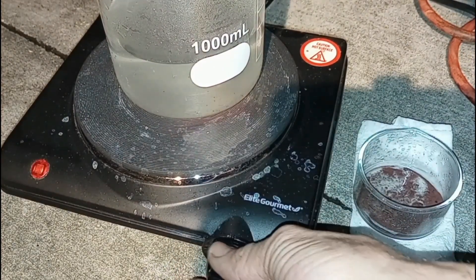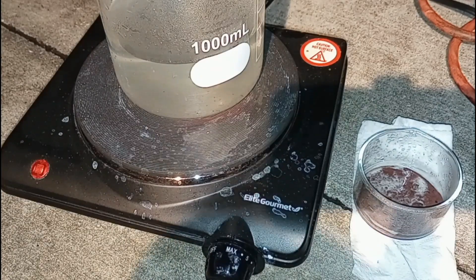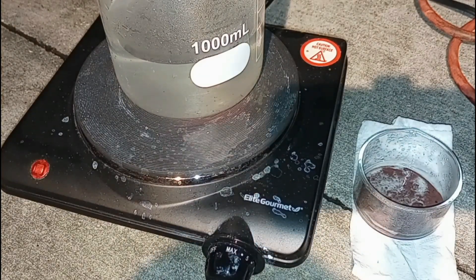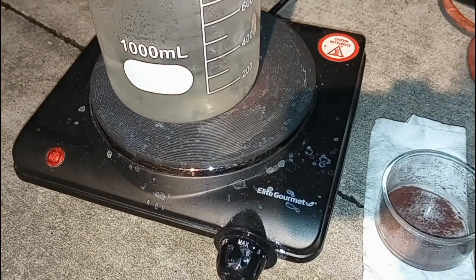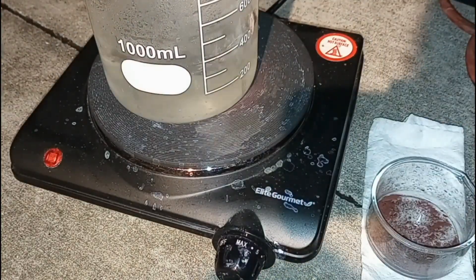So now the copper is dry enough, so we're going to take it off and turn the heat up to max so we can reduce this down faster. After it started to get almost dry, it started doing this. It kind of reminded me of making candy.